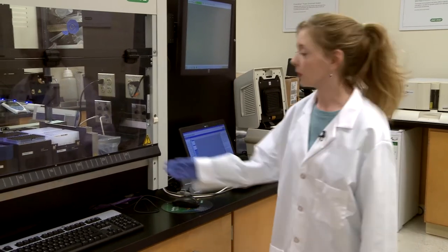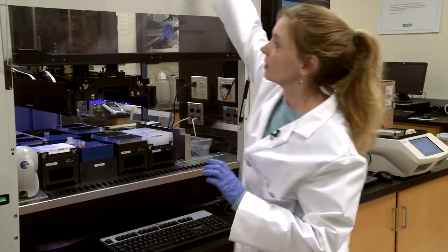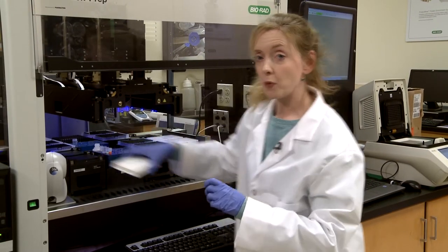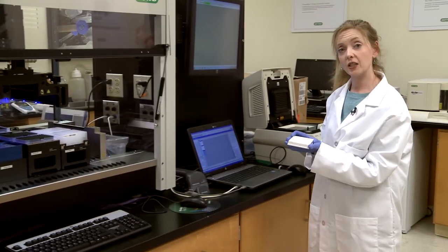Back from lunch. Now it's ready to get back to work. Let's grab our samples. So everything's been done by the robot and we're ready to put it into our thermal cycler.